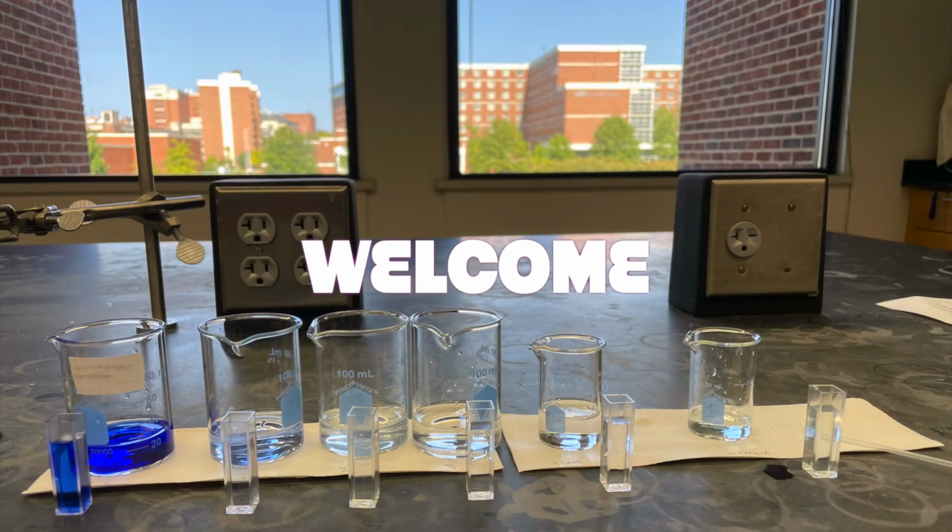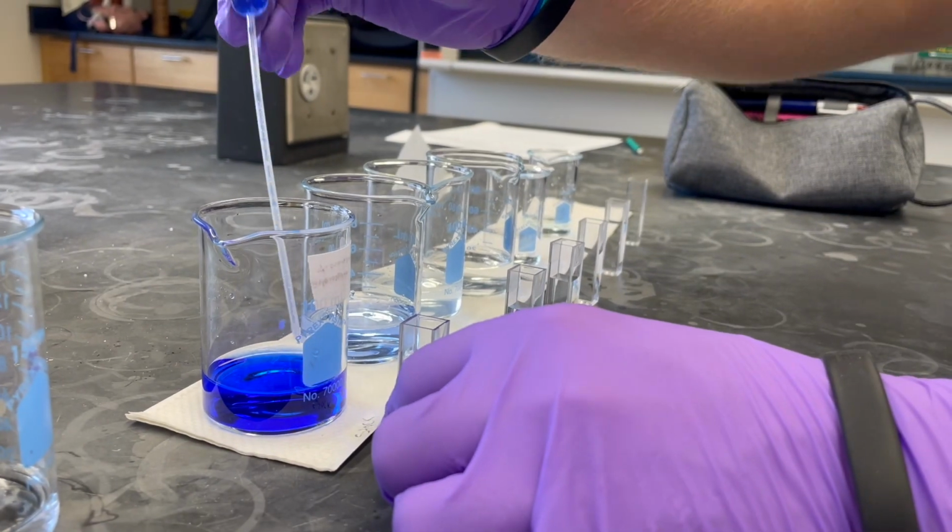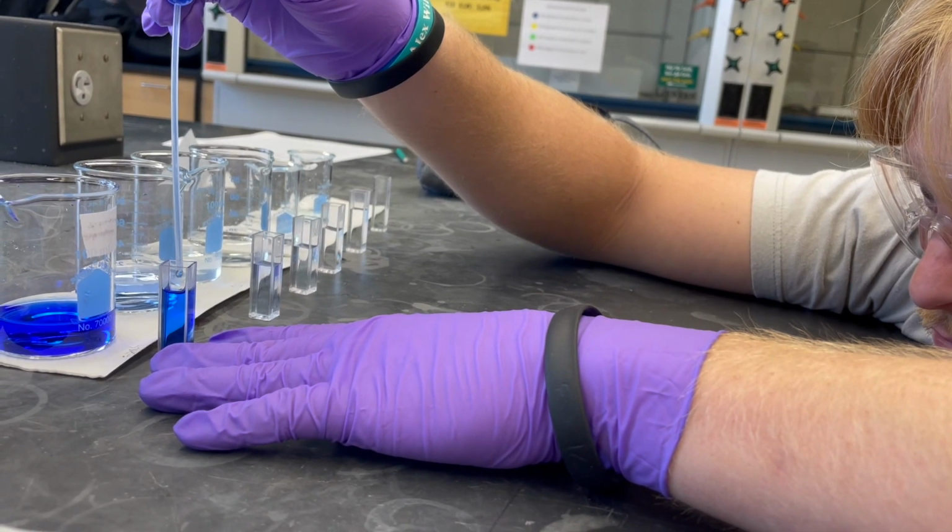Welcome. In this video, we will be going over the use of the spectrophotometer. In the first part of our lab, we made our stock solution. You will not always need to make your stock solution.